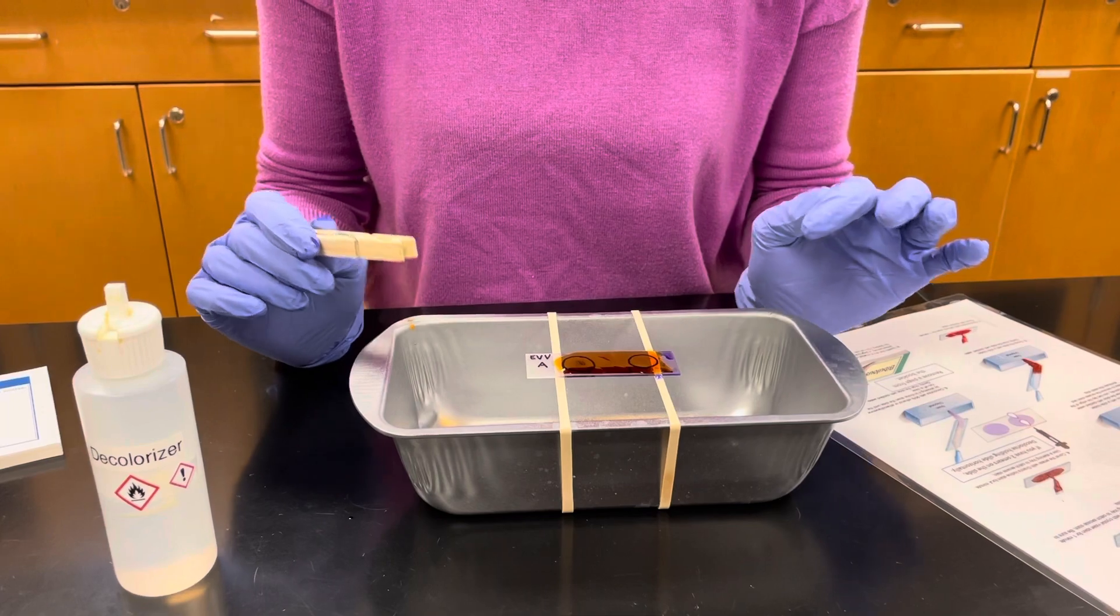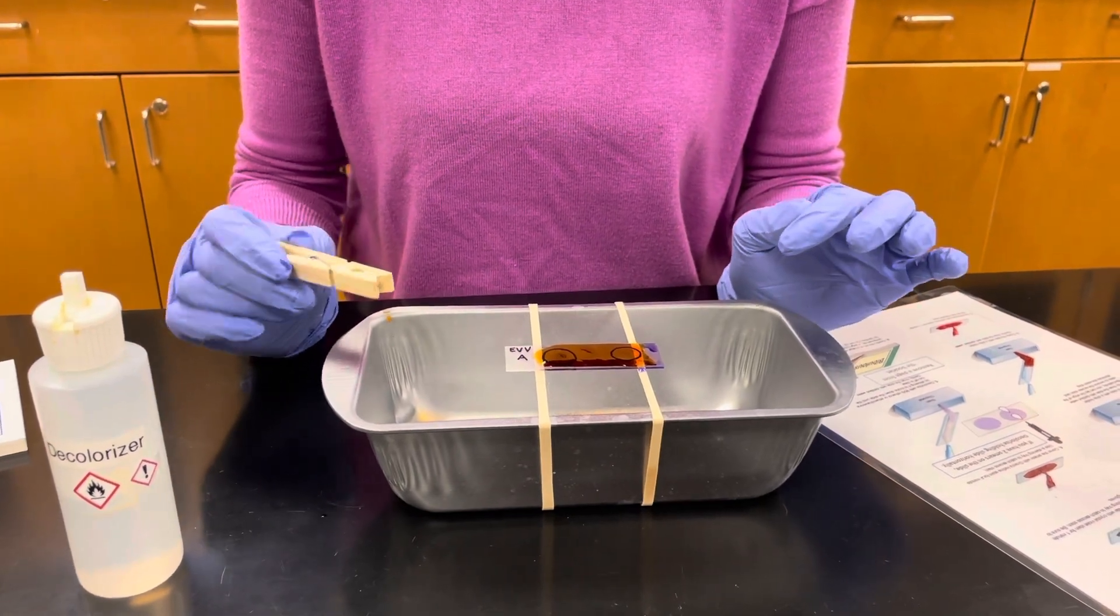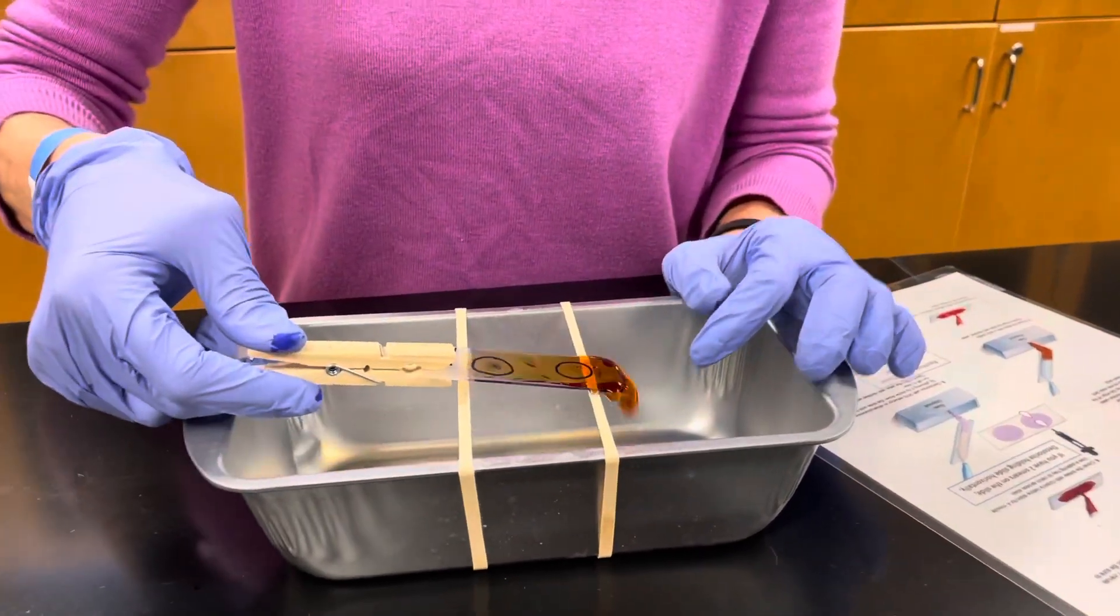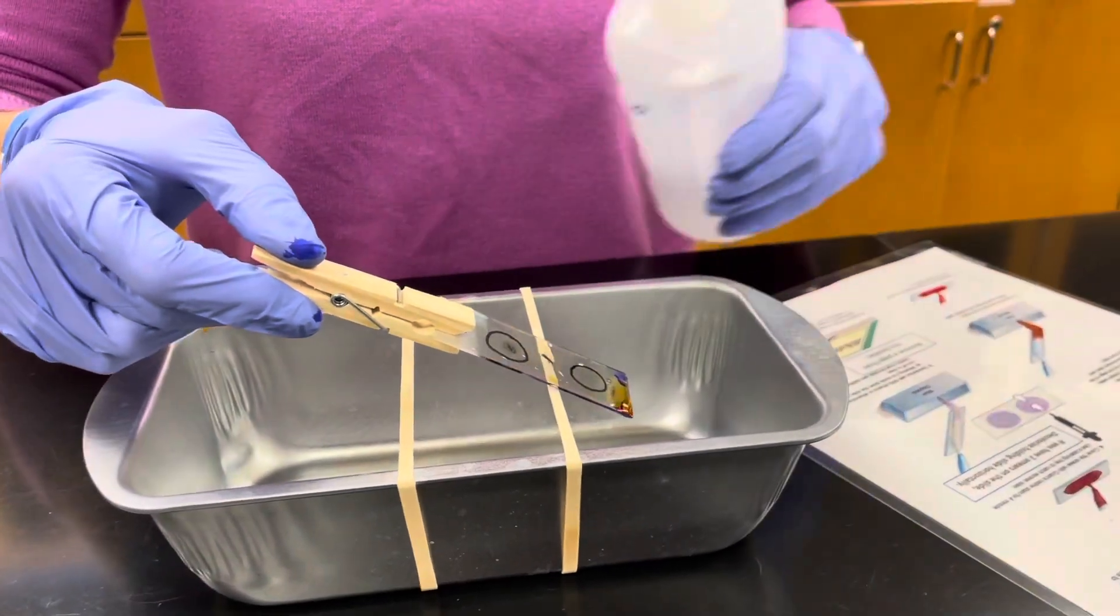Once the iodine has sat on your smear for one minute, we're going to rinse it gently with water.